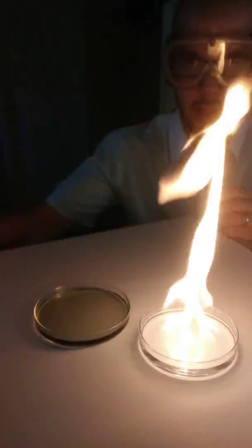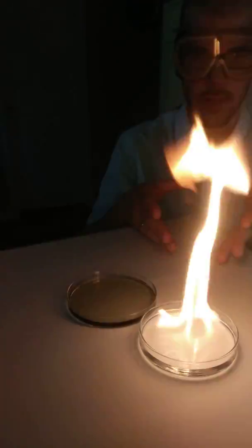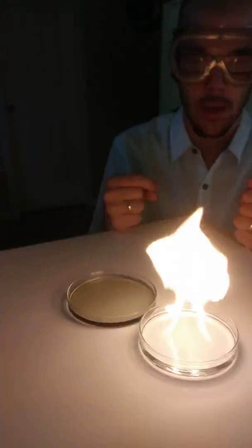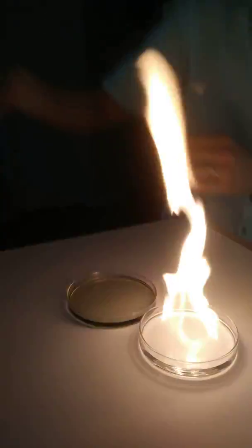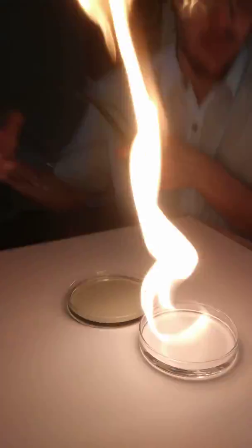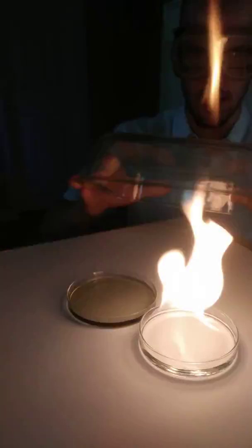Like the soda investigation, we're going to take this system that's at work right now and I'm going to cover it with the dish. Be careful not to get directly over the flame when placing the dish — let's go ahead and take a look at what happens in that scenario.